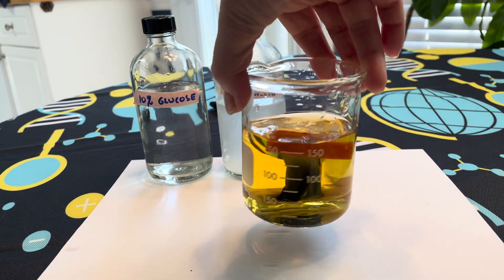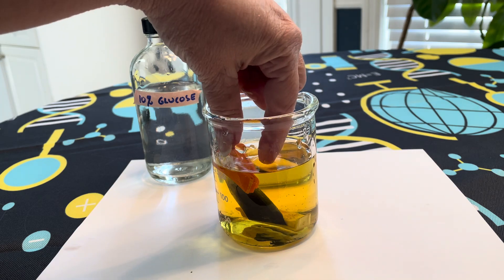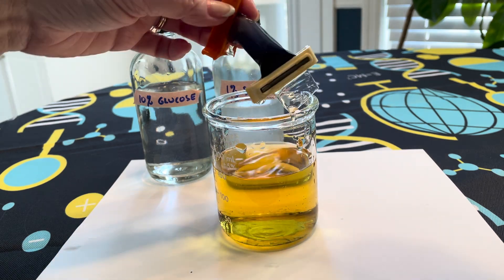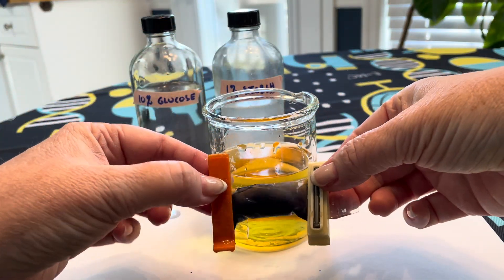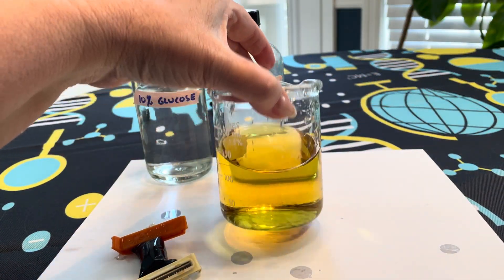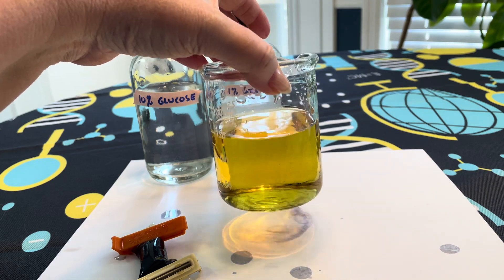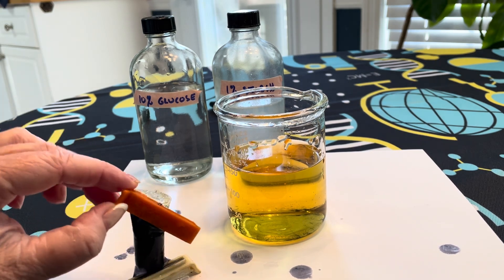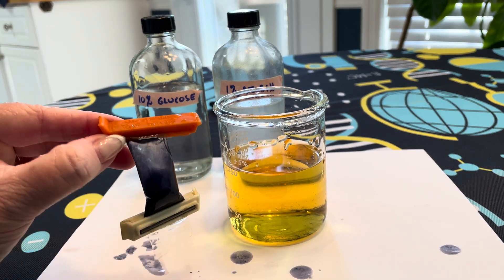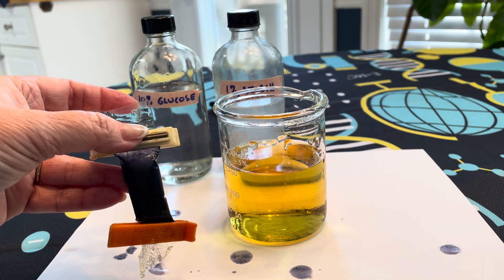I have one already set up for us. When we take a look, we see that things have changed. Specifically, the inside of the bag is now a blackish color, whereas the outside has remained the same color that it started. We can then get some information about that and determine how to answer the conclusions in the textbook. What we're observing is some properties of diffusion as it moves in and out of the dialysis bag, which simulates our plasma membrane.